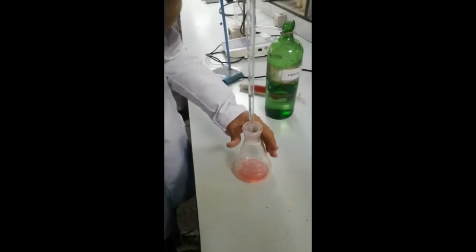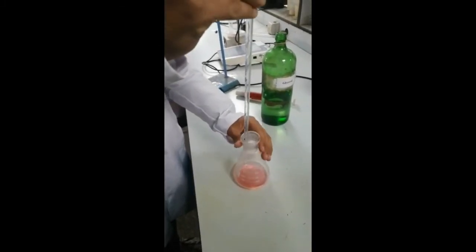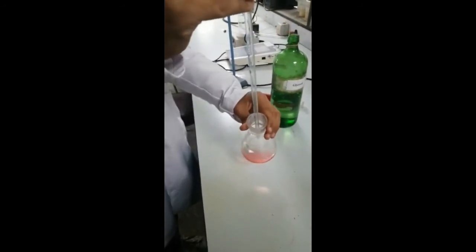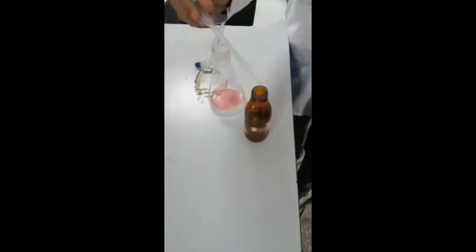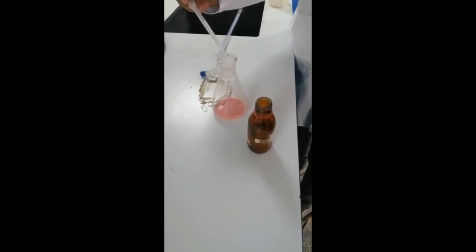Our second determination of today, boric acid. We add glycerol to the previous neutralized solution and then we titrate with standard sodium hydroxide using phenolphthalein to determine the boric acid resulted from hydrolysis of borax and boric acid which was originally present in the mixture.